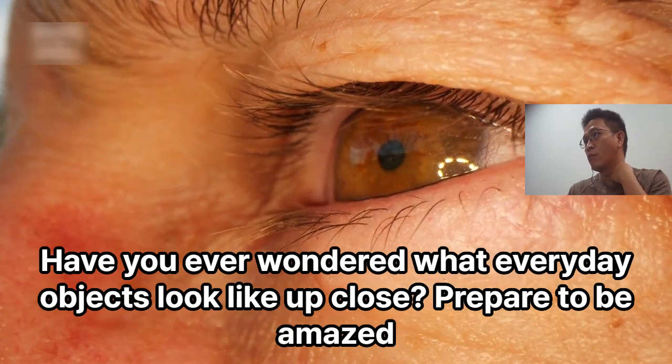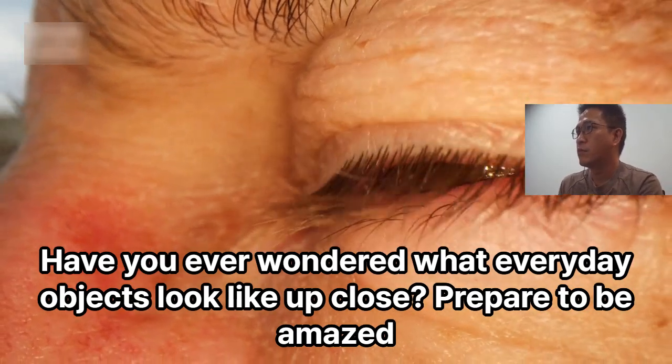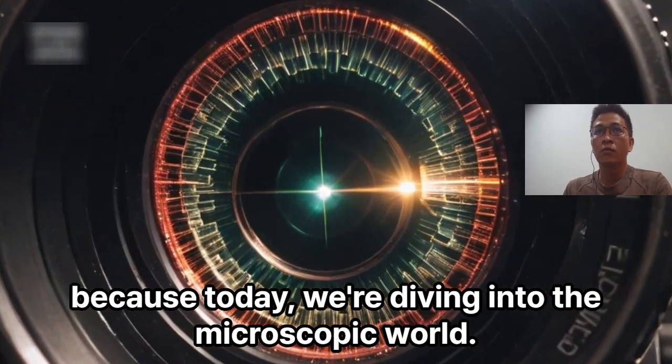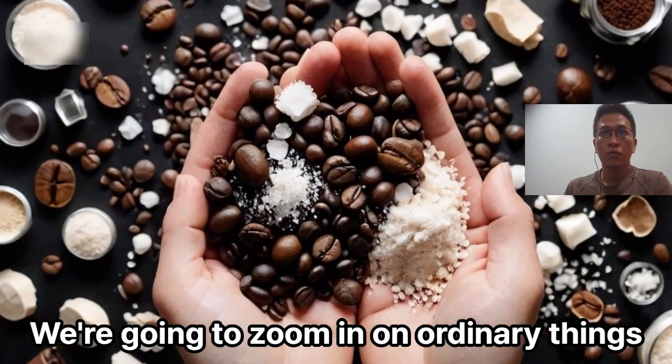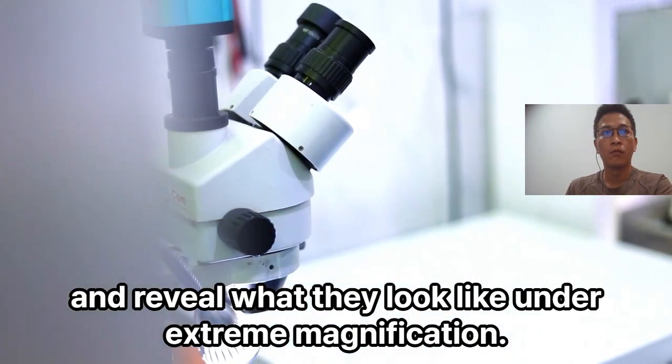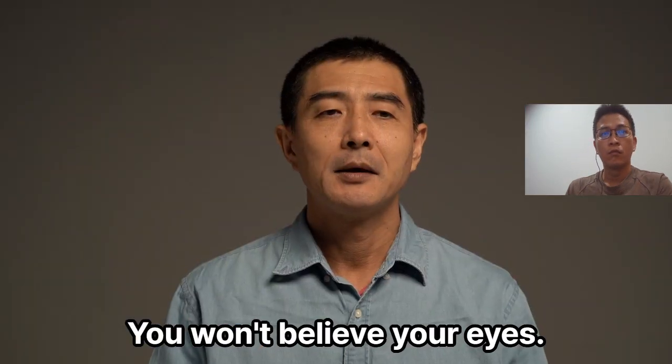Have you ever wondered what everyday objects look like up close? Prepare to be amazed, because today we're diving into the microscopic world. We're going to zoom in on ordinary things and reveal what they look like under extreme magnification. You won't believe your eyes.